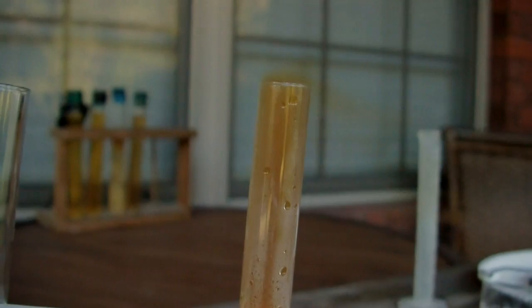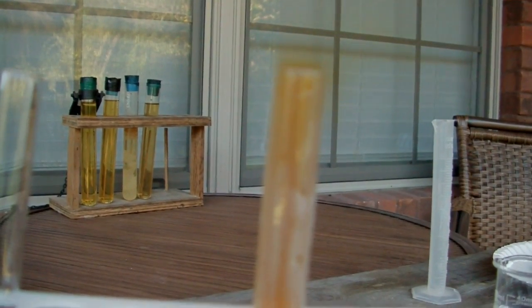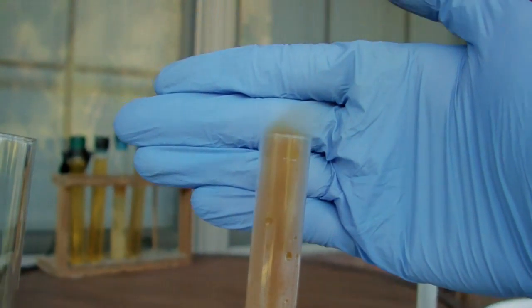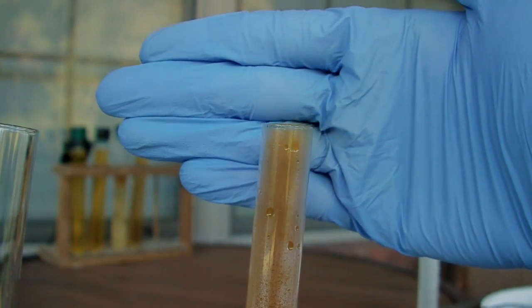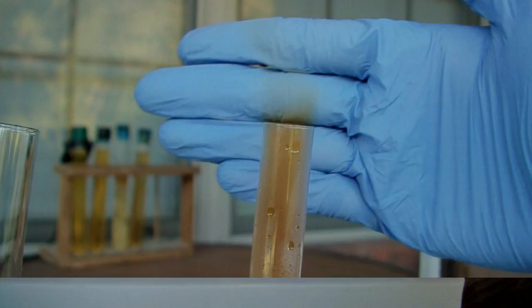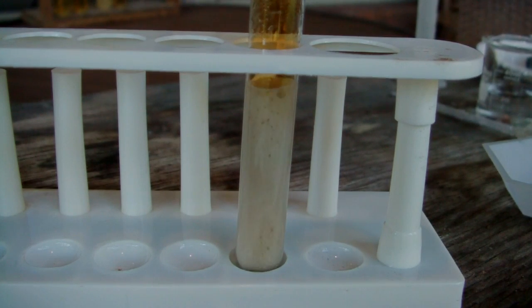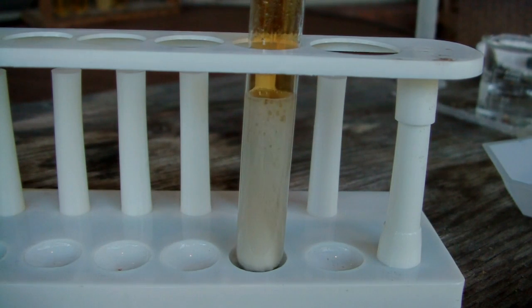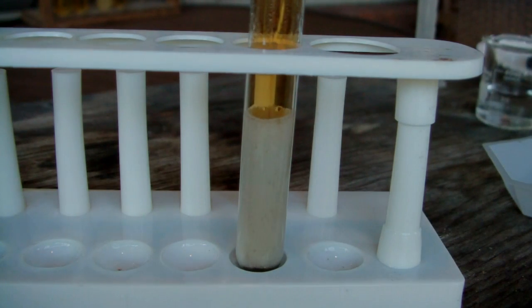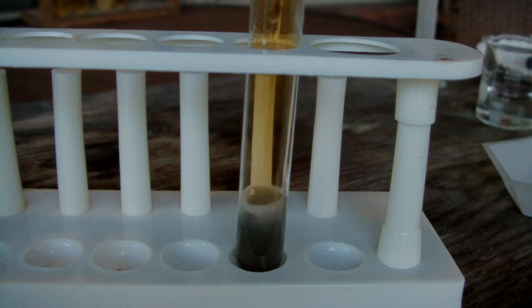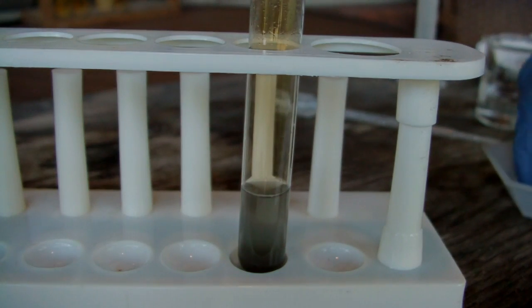You can see at the top of the test tube, the nitrogen dioxide is starting to come out the top, which is of course why I did this outside. You can see how much it's bubbling there right now. Oh wow, the test tube is incredibly hot! I might add some more water to slow this down further.